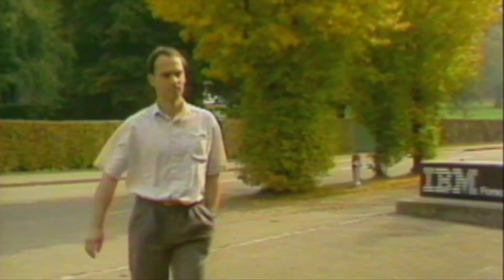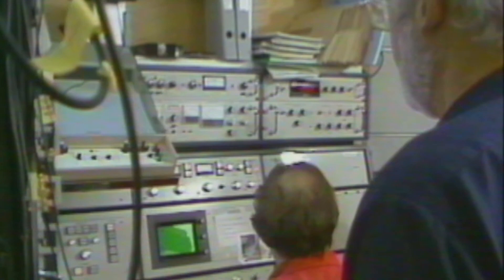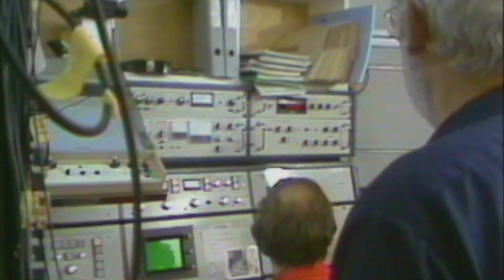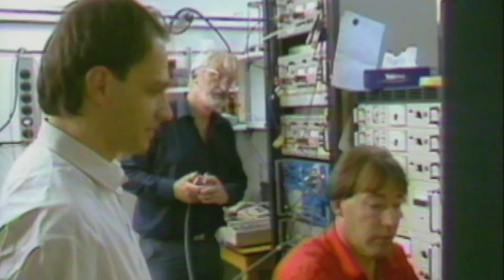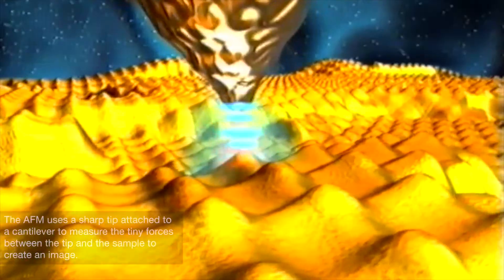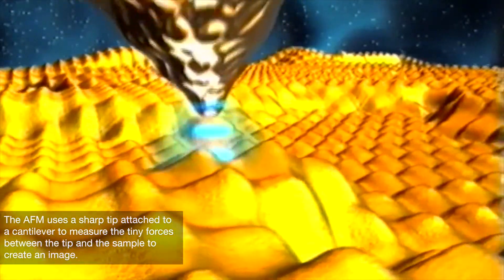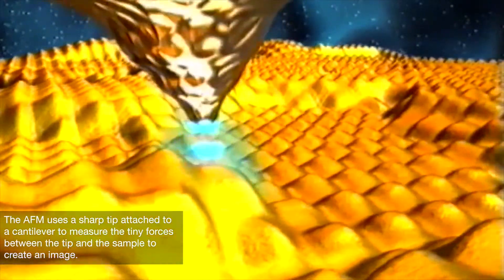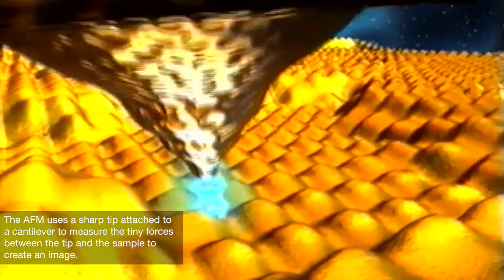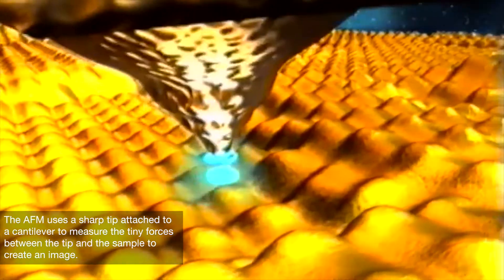Invented 30 years ago by IBM scientists, atomic force microscopy gave rise to a whole family of related instruments and techniques that have revolutionized our ability to view, explore and manipulate surfaces and materials that were not previously observable.